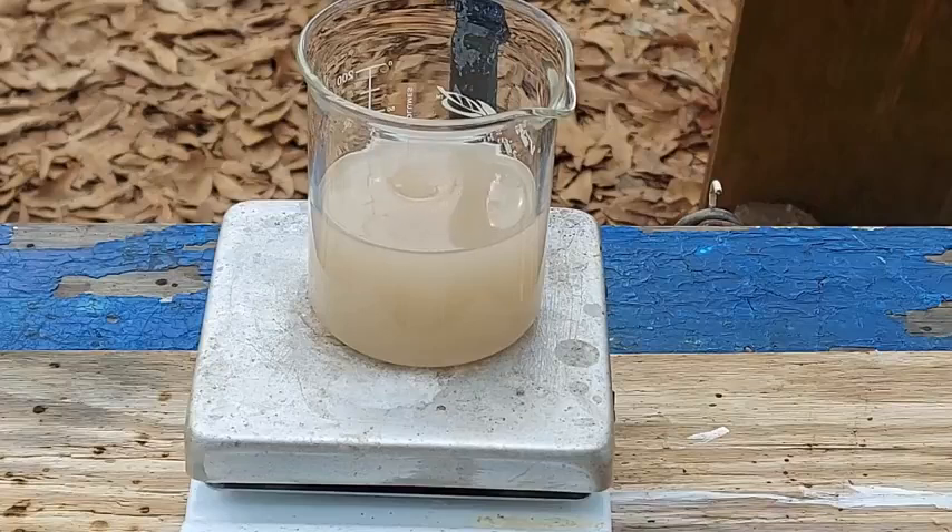Normally it only does that if there's actually a lot of solid in there. I don't know that there's a lot in there but there is some - and that's all I care about. We got it! After months of trying to make this. Well, I've only actually tried to make it like three times, but still - after two failures, finally have some success. It's very nice.